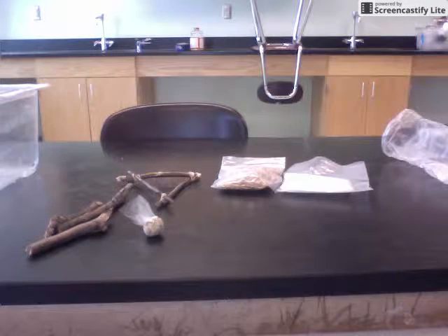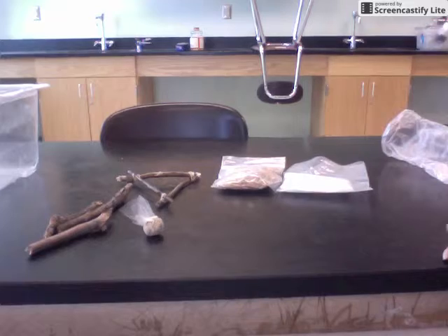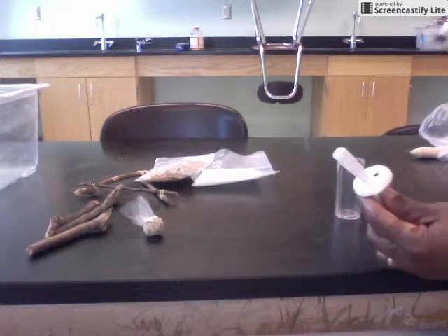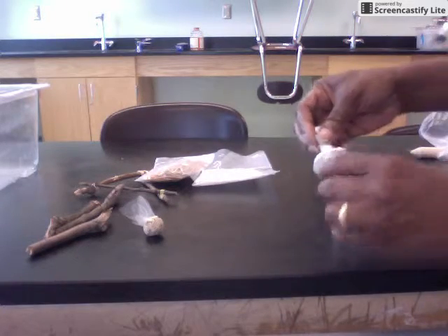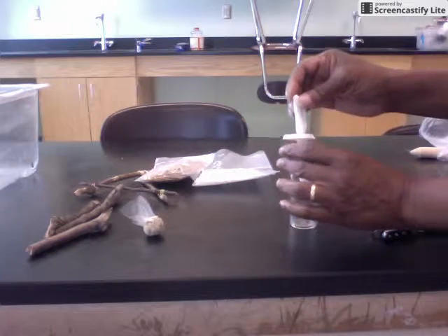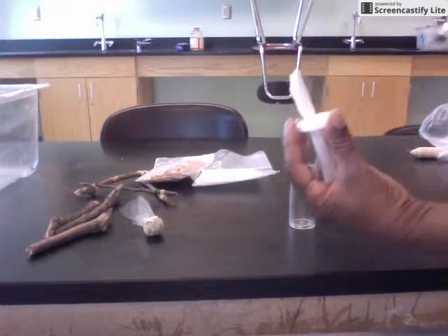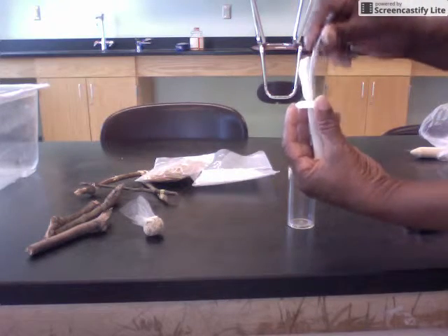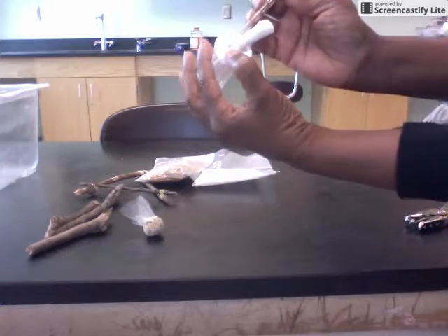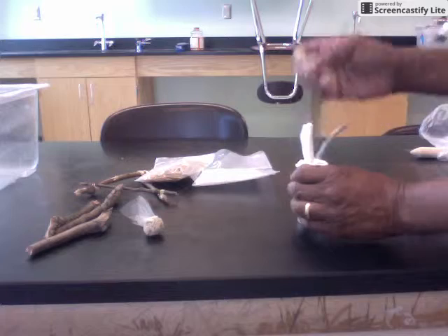Next we create the water fountain, because organisms need both food and water to thrive. I give students a hole puncher to punch one hole, then roll up a paper towel and insert it as a wick — the bottom sits in water, absorbing it to the top, which is how the bugs drink. The other hole should be made with a sharpened pencil. I made the mistake of using a hole punch, which causes the tubing to move up and down, allowing first-instar bugs to climb in and drown. Use a sharpened pencil and apply pressure — it will work.